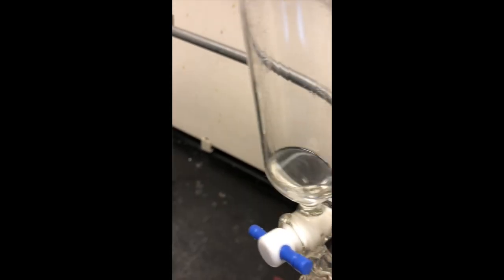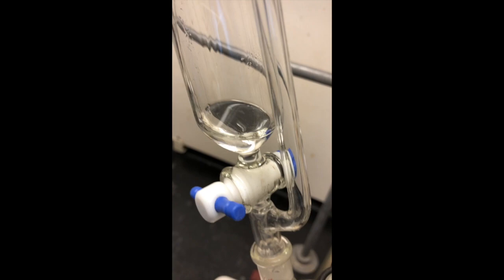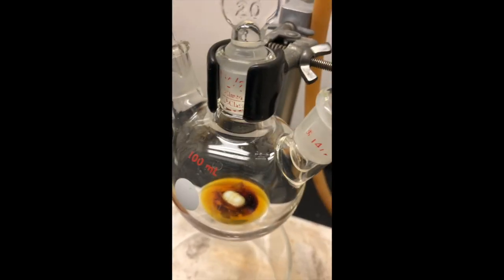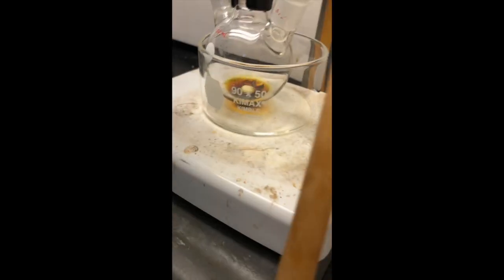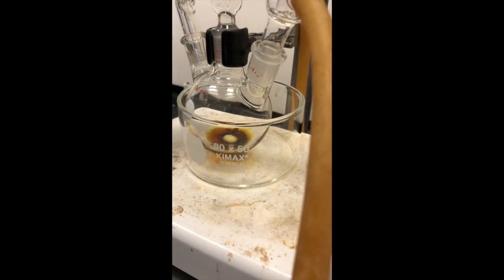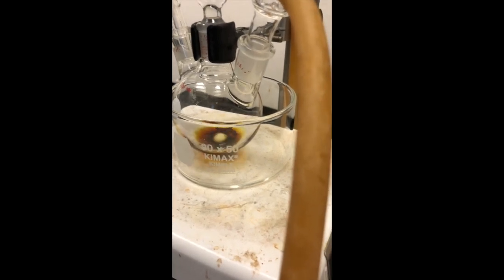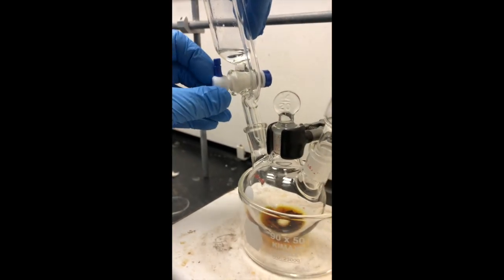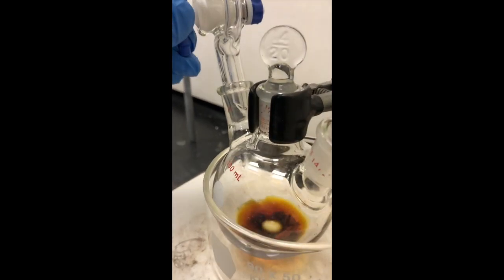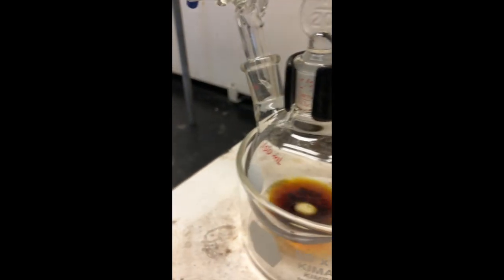There's our ether solution with bromobenzene in the funnel ready for addition into the Grignard, where the ether has now dissolved the iodine. We placed the reaction flask into the crystallizing dish so it can start stirring. We're going to add about half of the bromobenzene mixture — you just have to eyeball what about half would be — so about half of it is left.